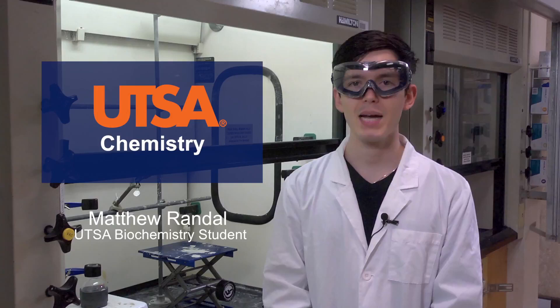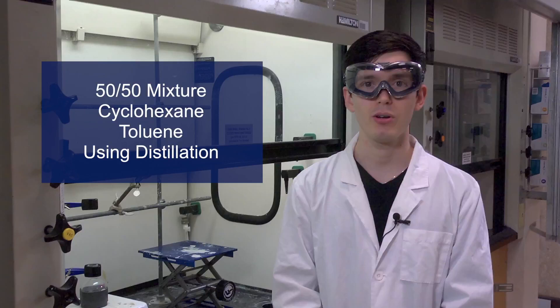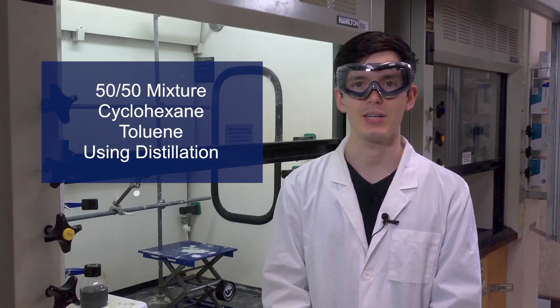Hello, my name is Matthew Randall. I am a biochemistry student at the University of Texas at San Antonio. Today, I will be showing you how to separate a 50-50 mixture of cyclohexane and toluene using distillation.